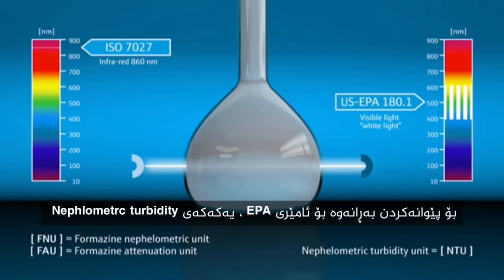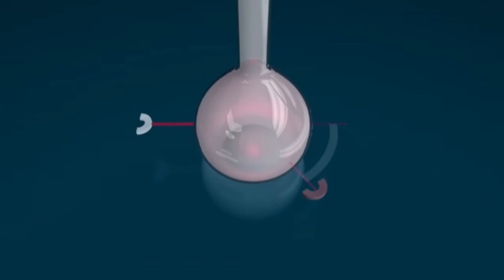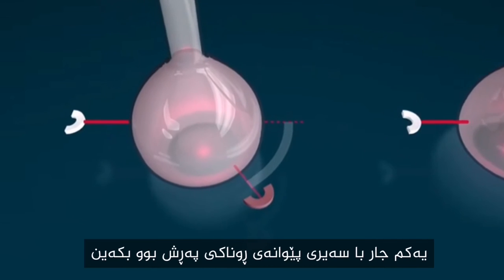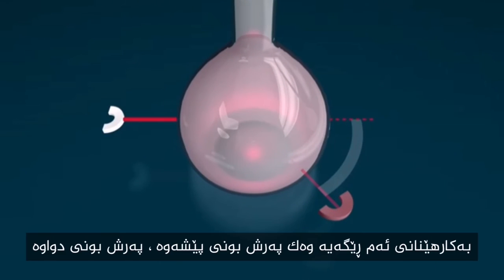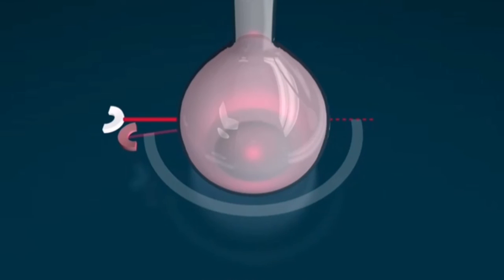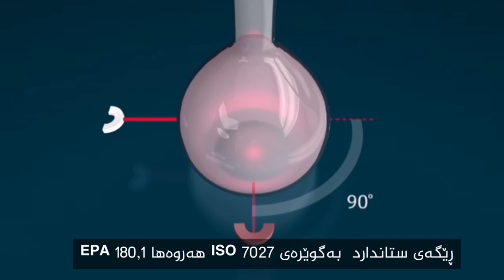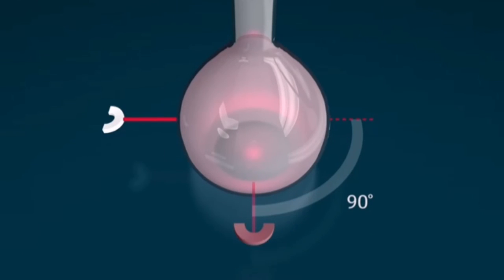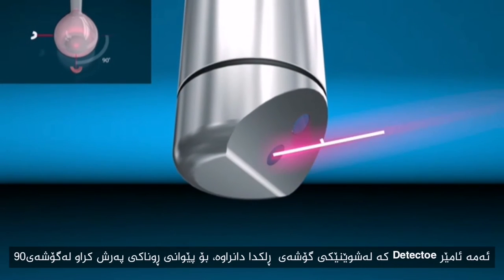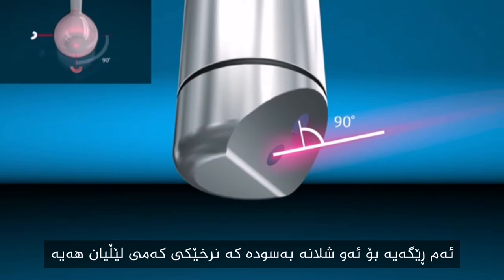The most widely used measurement methods for turbidity are scattered light measurement and attenuation measurement. Using scattered light measurement, either the forward scattering, backward scattering, or the 90-degree scattering is measured. The standard method according to ISO 7027 and EPA 180.1 is the 90-degree measurement, where the detector is positioned at a right angle from the light source to measure the light scattered at 90 degrees from the incident light. This method is suitable for low turbidity values.